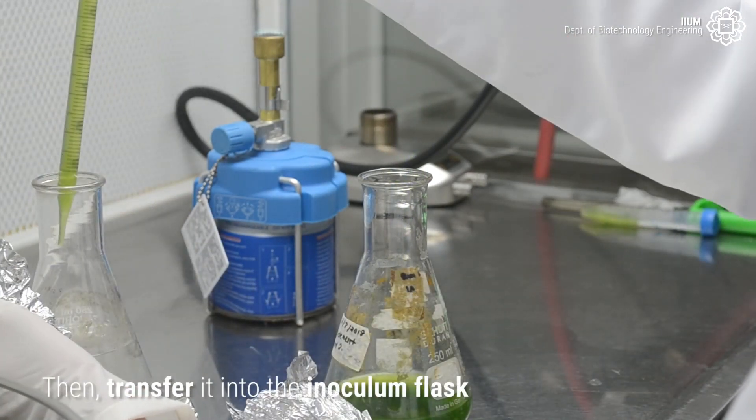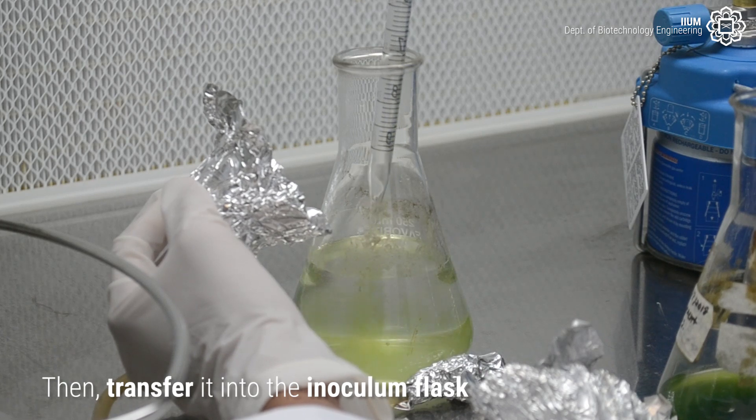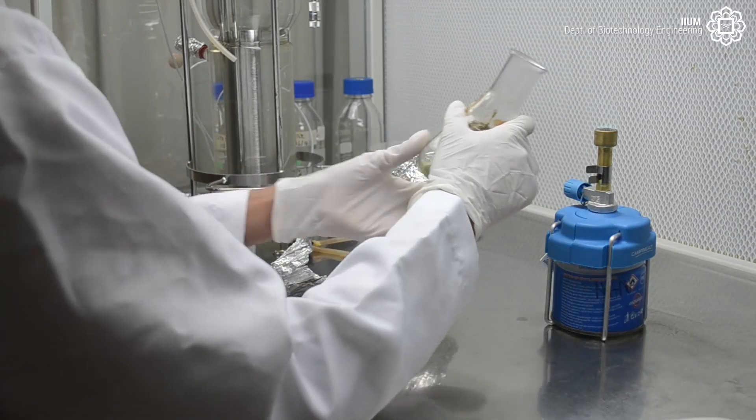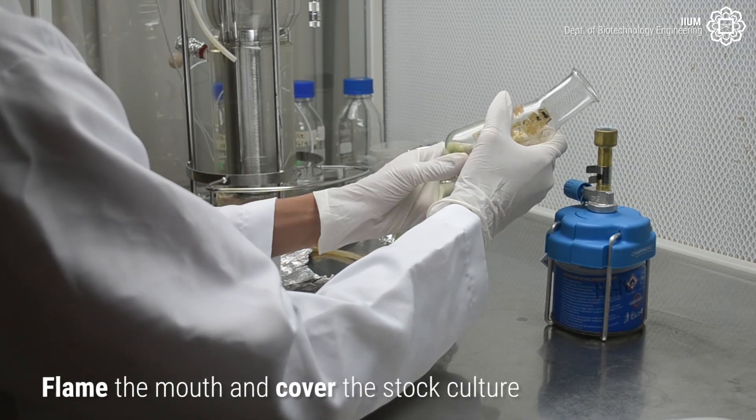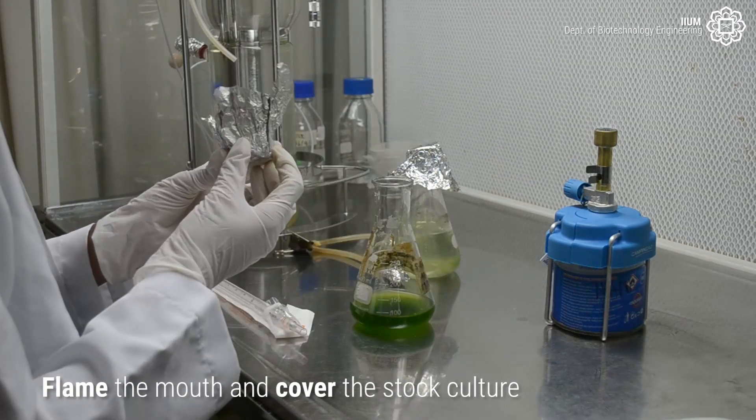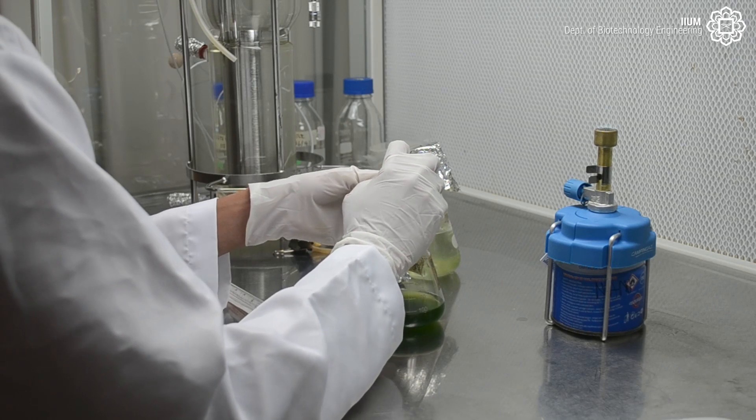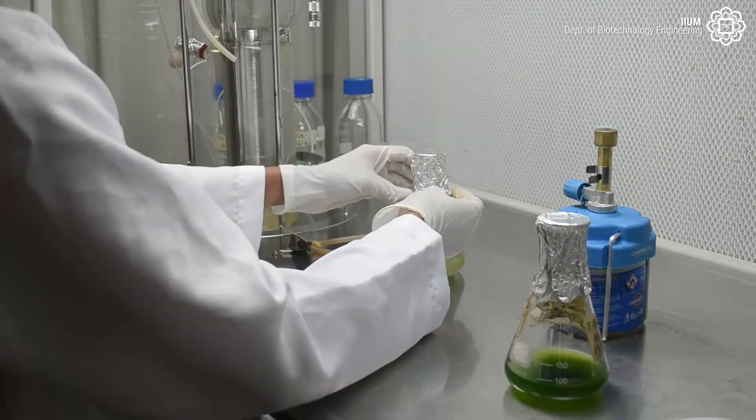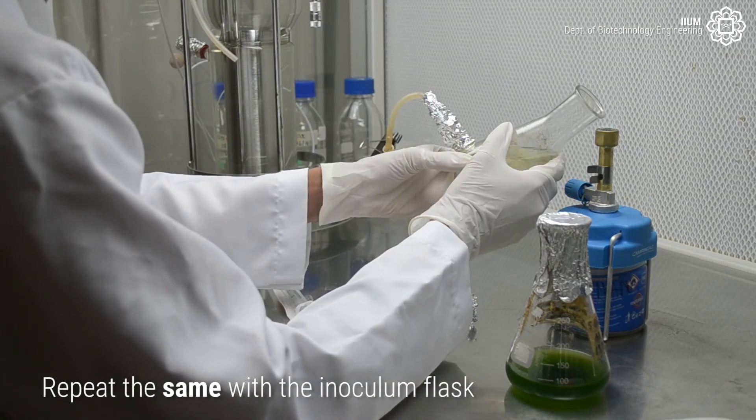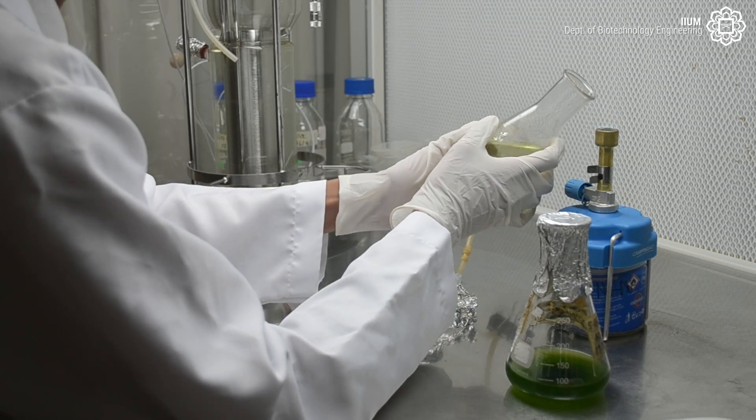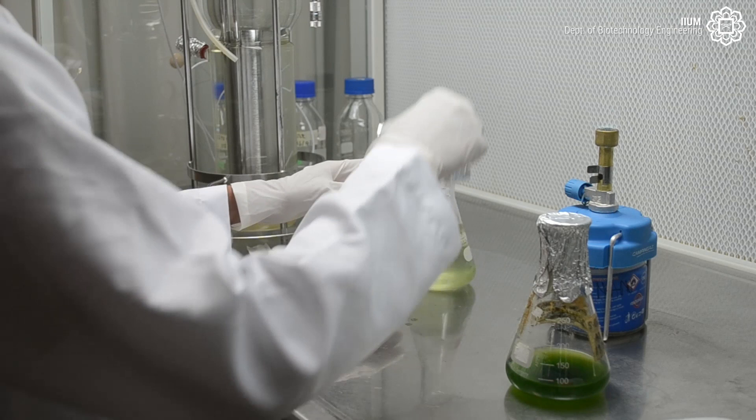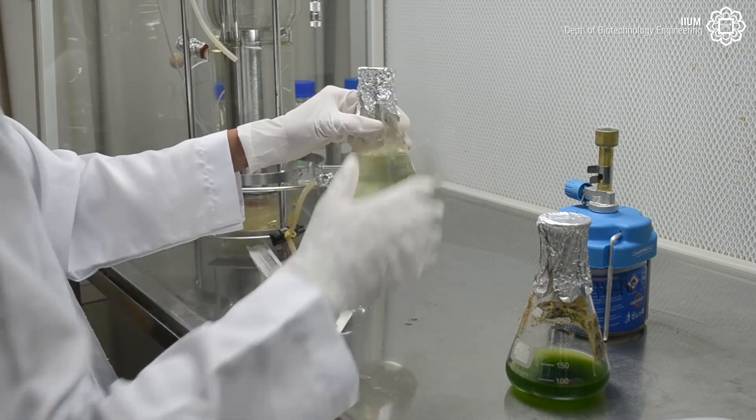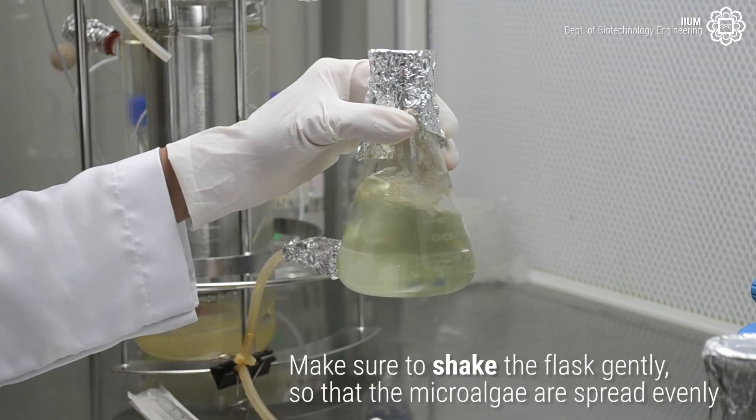Then transfer it into the inoculum flask. Flame the mouth and cover the stock culture. Repeat the same with the inoculum flask. Make sure to shake the flask gently so that the microalgae are spread evenly.